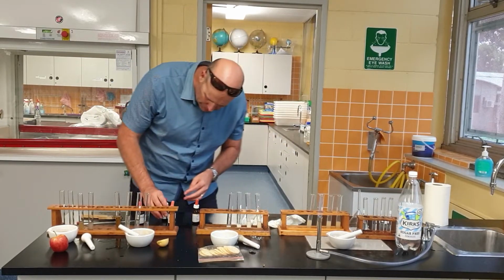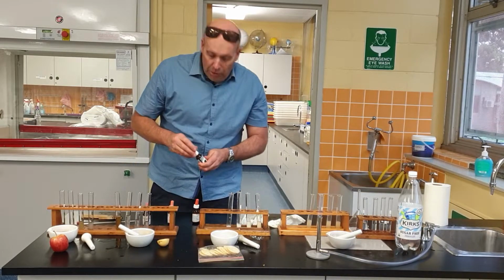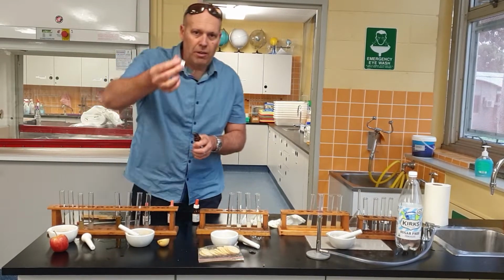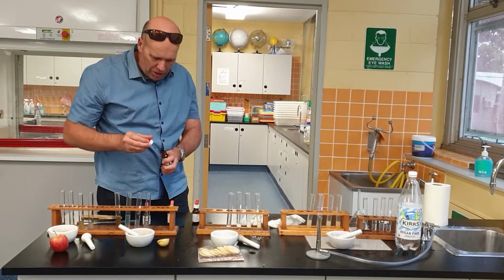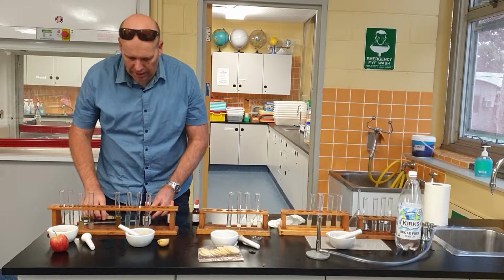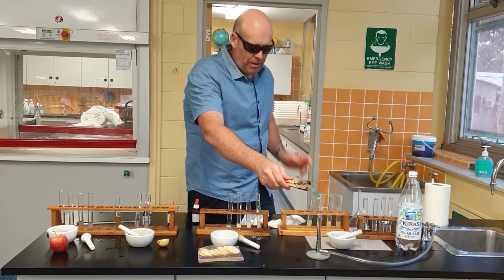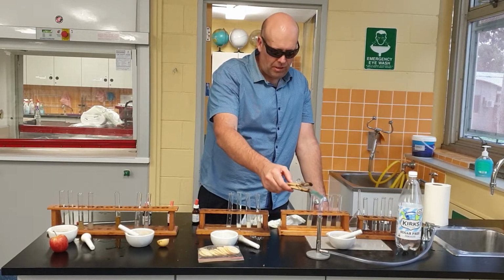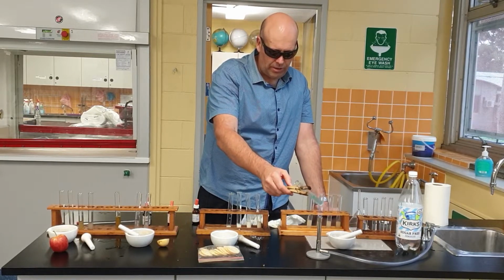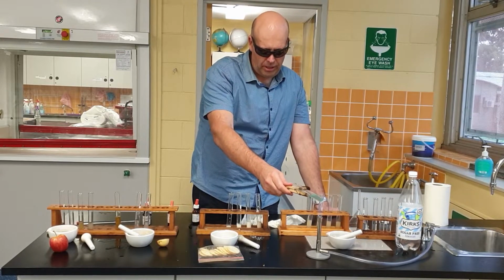Okay, what about glucose? Let's try the glucose. Well, what do we need for glucose? Absolutely, we need this stuff, the blue stuff, the Benedict's. So I'm going to put some Benedict's solution in there, and I'm going to put the heat on and heat it up, and let's just see, what do we reckon? Are we going to get a positive test? So we're seeing whether there's actually some sugars in here, some glucose. So, a little bit of heat, give it a sec.